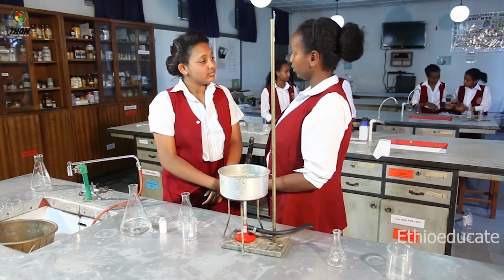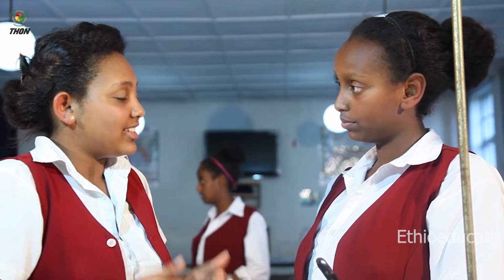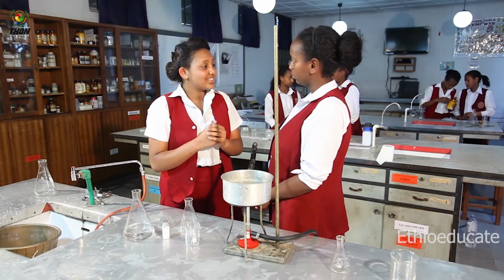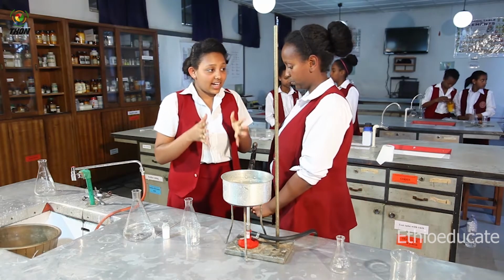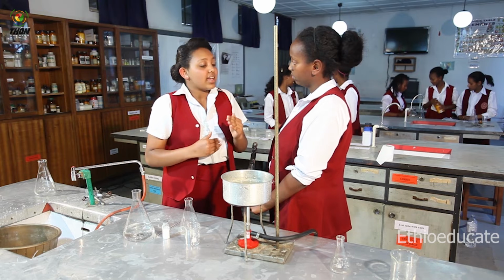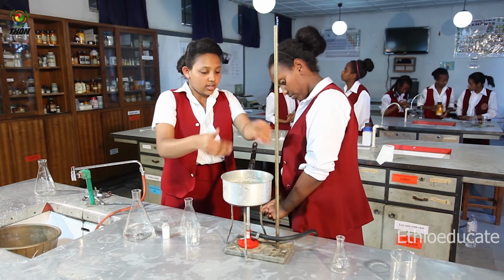Yes. So Kebra, what experiment are you going to perform? I'm going to show you one of the methods of purification of compounds, that is recrystallization. What is recrystallization? Recrystallization is the process by which we can purify solids. Okay, show me. So, the main principle behind recrystallization is that the amount of solid that can be dissolved in a solvent can be increased by increasing temperature. That is why we have Bunsen burner here and a water bath.